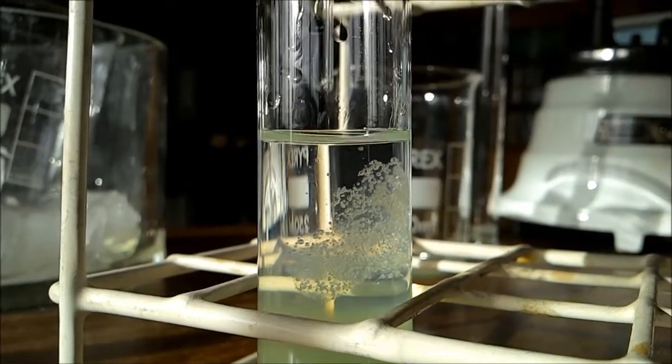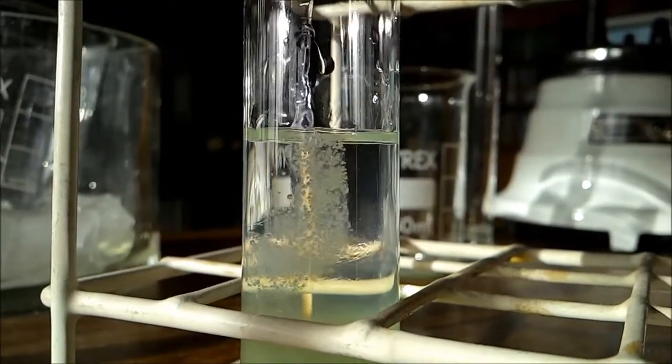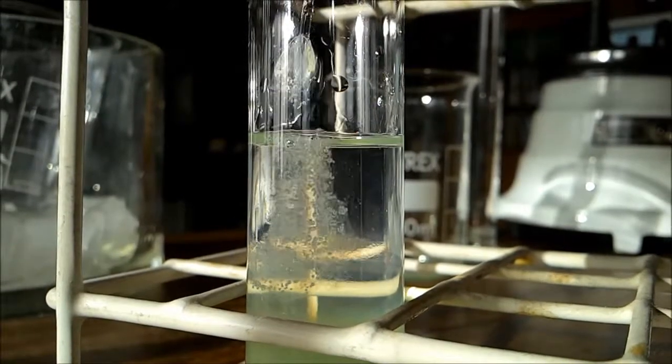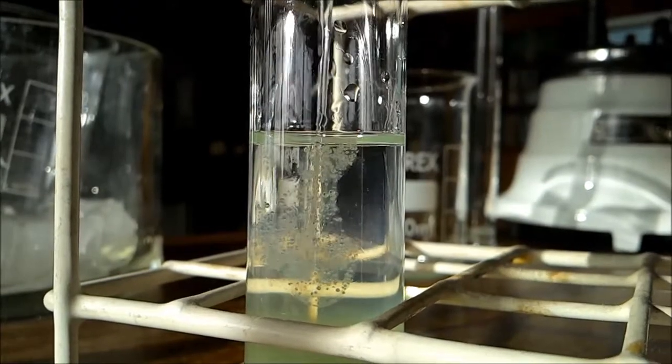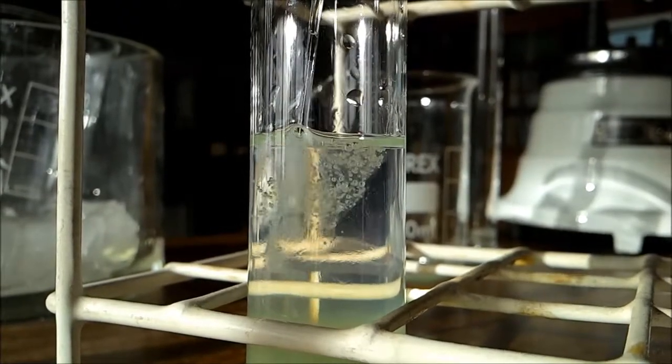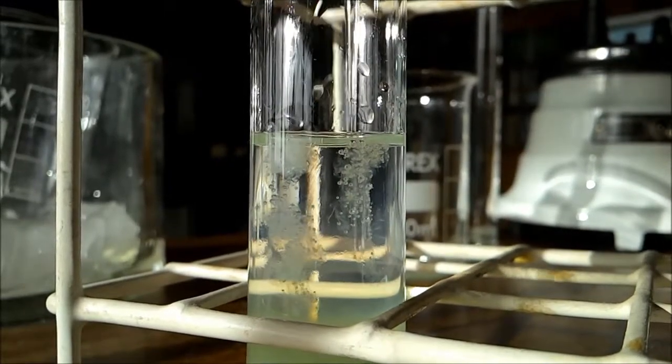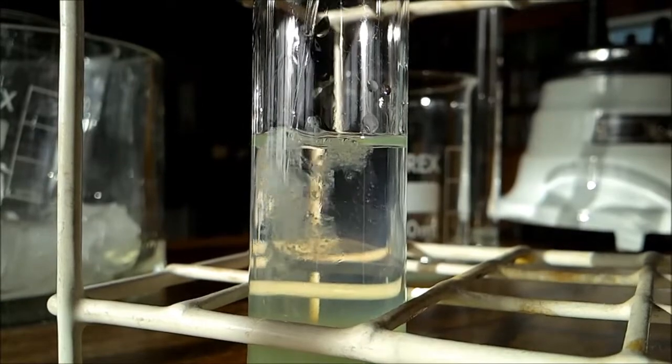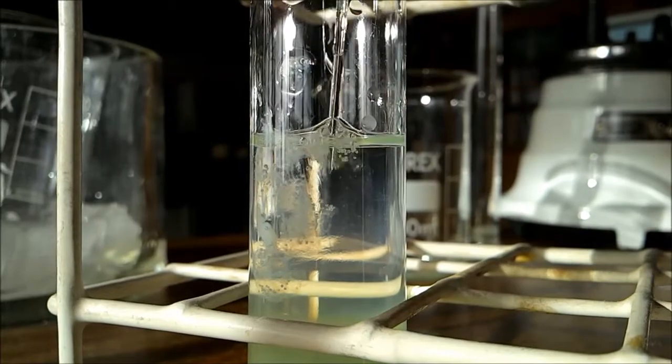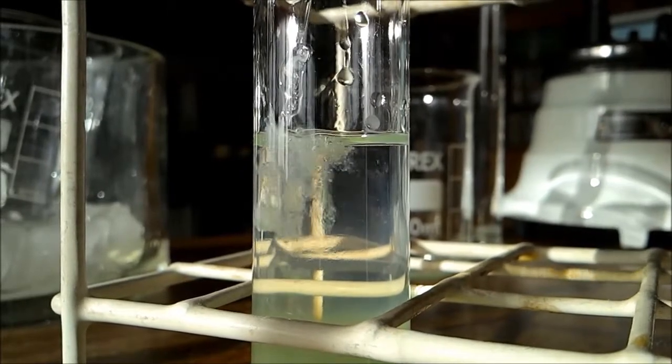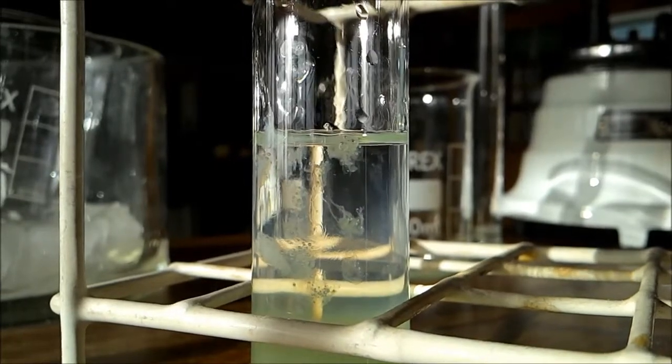This is DNA. You can lift it. You can see it's fibrous, it sticks together. That's the DNA of the onion lifting up out of the tube. You can see the fibers, the way it clumps together and holds itself. It's not a solution, it's fibers of DNA - many thousands of strands, hundreds of thousands of strands of DNA which you've extracted out of the onion.